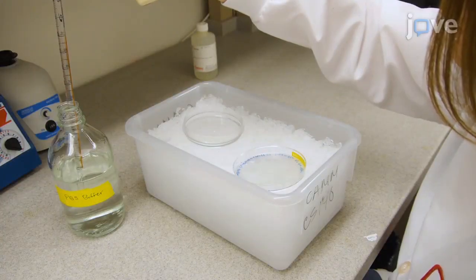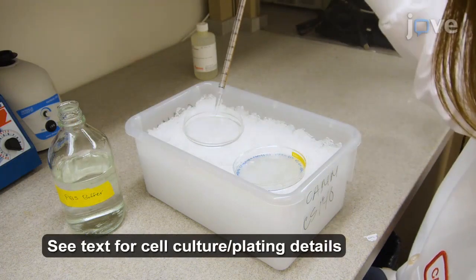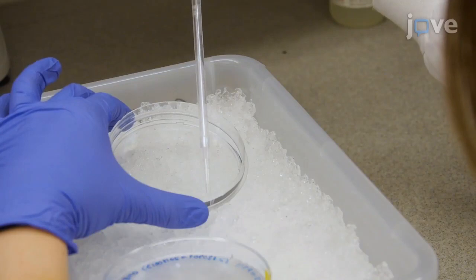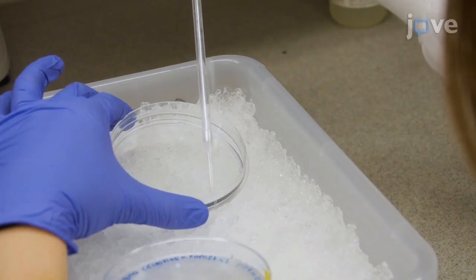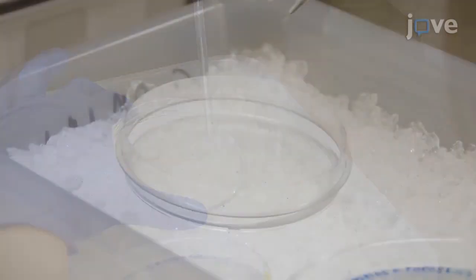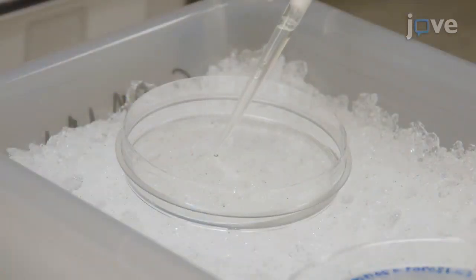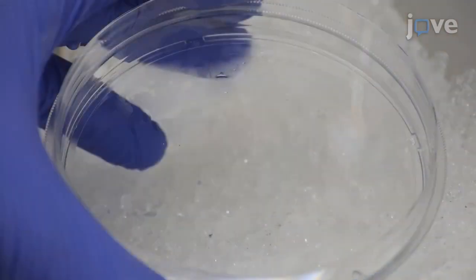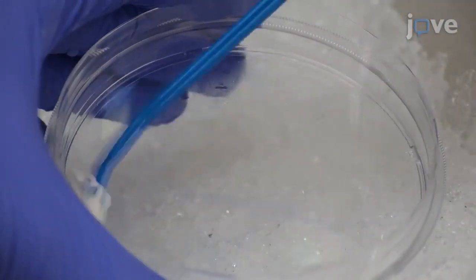Begin by thoroughly rinsing overnight cultured cells 3 times with 10 milliliters of PBS, taking care to remove all of the PBS after the last wash. Next, add the appropriate volume of lysis buffer from the protein assay kit, and use a cell scraper to detach the cells.